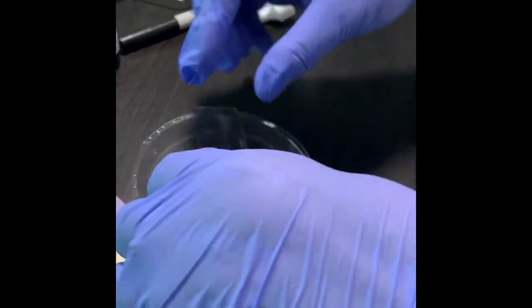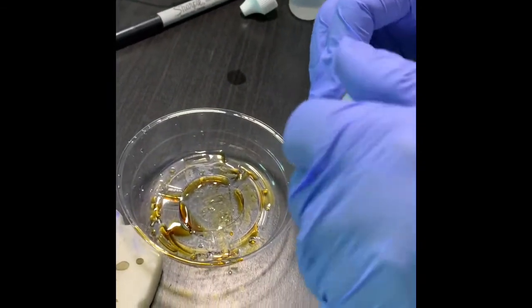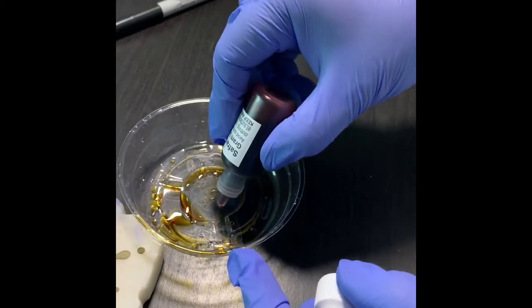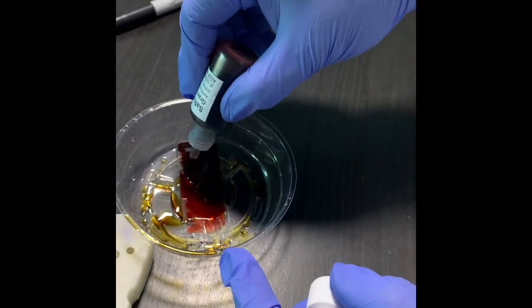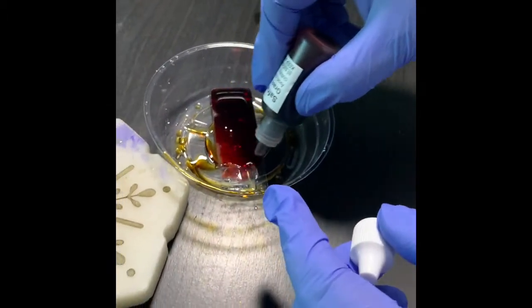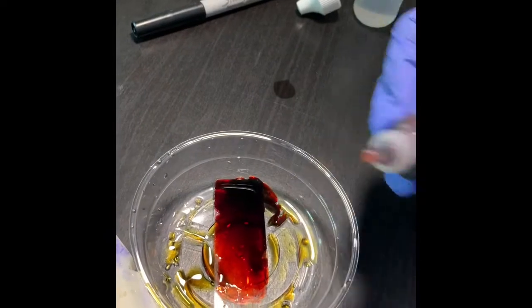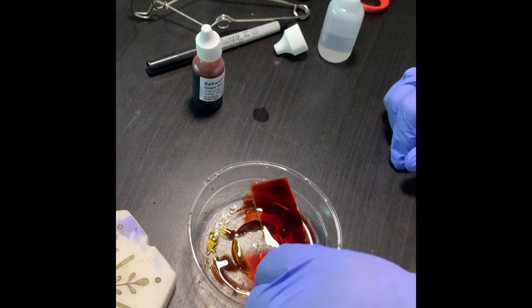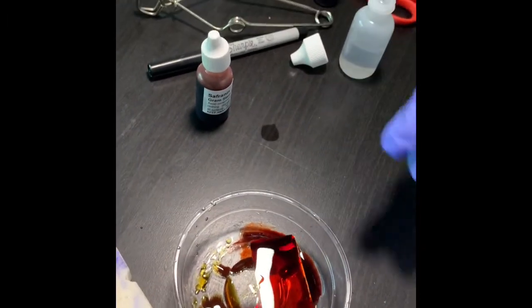Now I will apply the last counterstain, that is safranin, the secondary stain, and that will be for 30 to 45 seconds. Okay, so after that I'm coming back. Okay, so 45 seconds for me, it is 45 seconds. So 45 seconds over, you can do for 30 seconds.